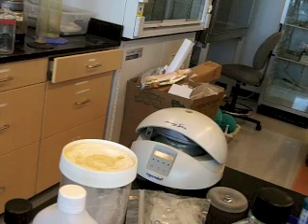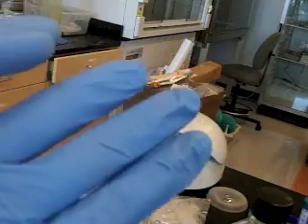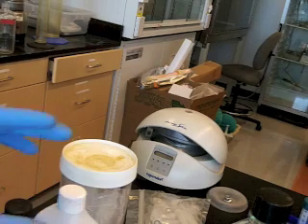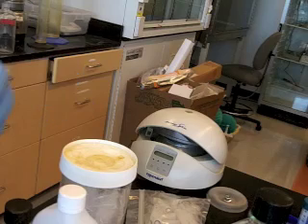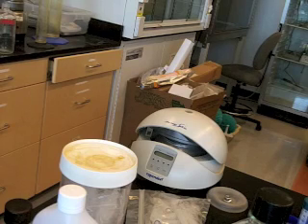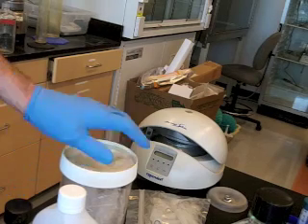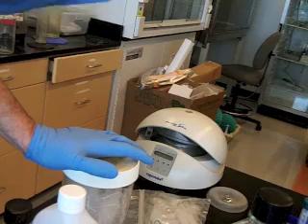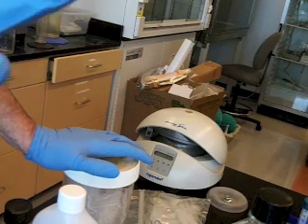The first thing is that we almost always wear gloves when we're micropipetting, and most of the time it's to protect our samples from us. Most of the time when we're talking about samples in this setting, it will be DNA, RNA. In the environment, from formerly living cells, is dust that includes the carcasses of old cells from our skin and every other kind of organism. There are some enzymes in those, and some of the enzymes that degrade DNA and especially RNA, ribonucleases, are really stable. So when we're working with DNA and RNA, we're concerned about the dust in the air and just the materials on our fingers. So we wear gloves to protect our samples.